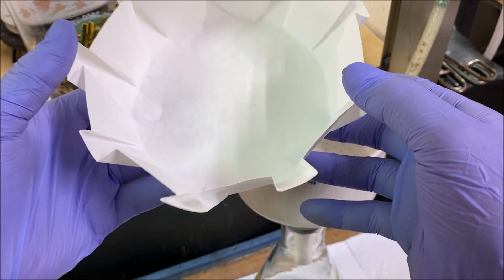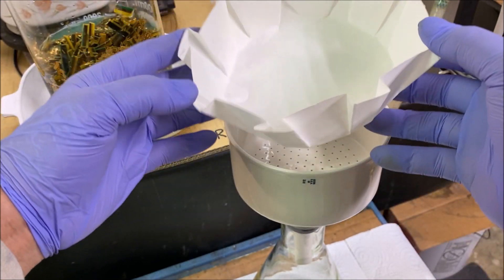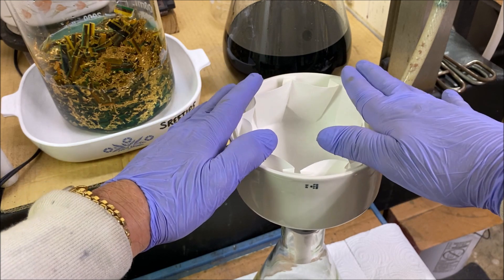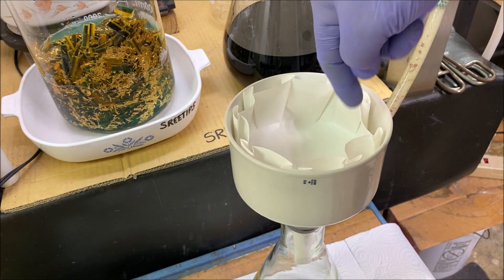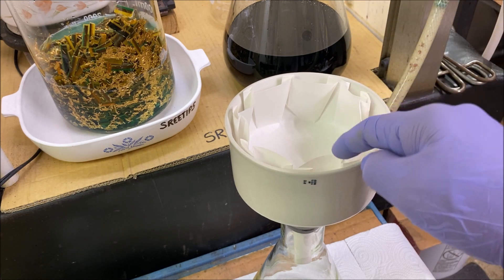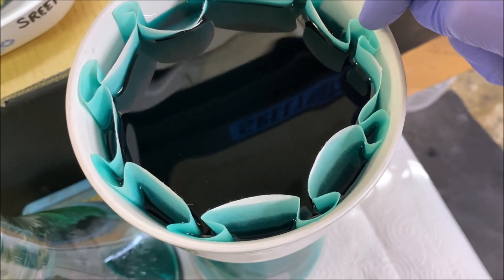So when we use one of these specially prepared filters, the filter rides up the inside walls of the funnel, and so we can capture 100% of our solid material in this filter if you've got these proper folds in here like this.